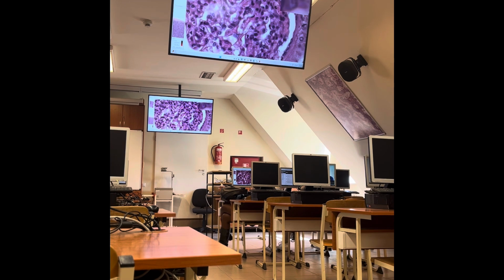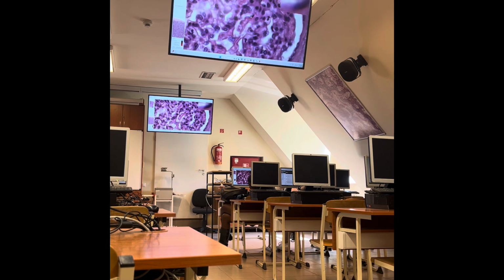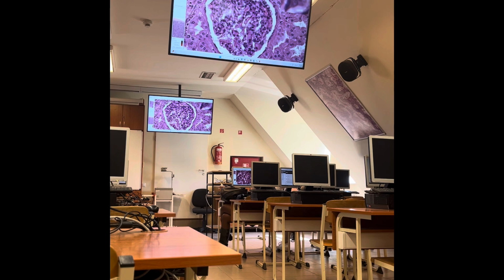Also here you can see these light staining cell nuclei. Endothelial cells are obviously different. They have heterochromatic staining and a very flat shape, so these are endothelial cells. And there is a third cell type among the loops of the capillary.